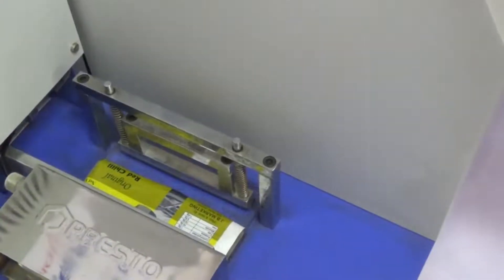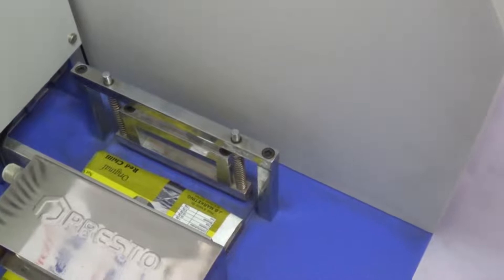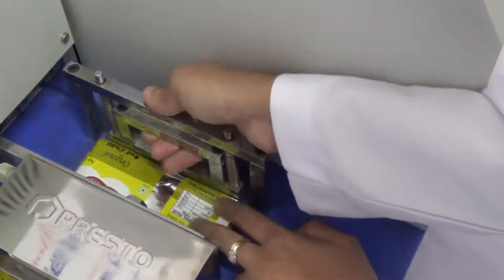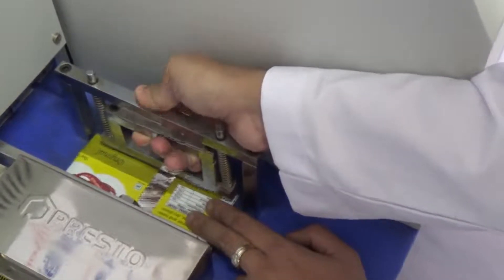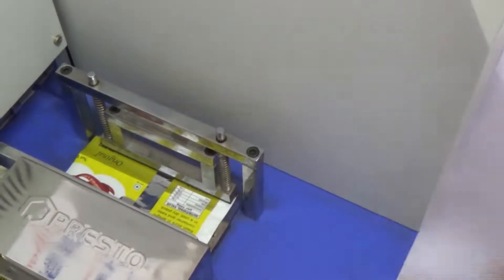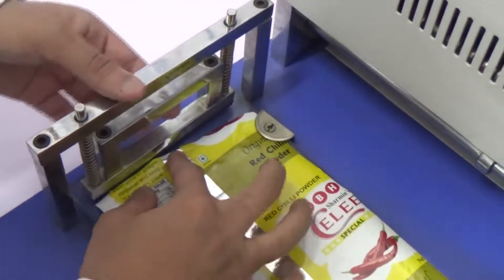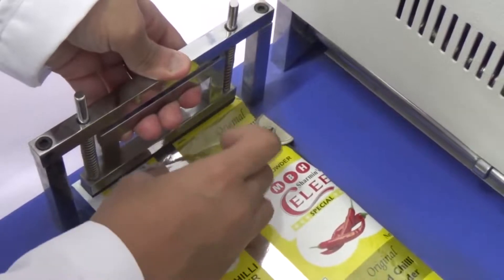Placement of Sample: We place the sample on the glass surface and slide it over the right side. Move the clamp upwards and clamp the sample. In similar way, place the sample on the left side and clamp it using the left clamp.